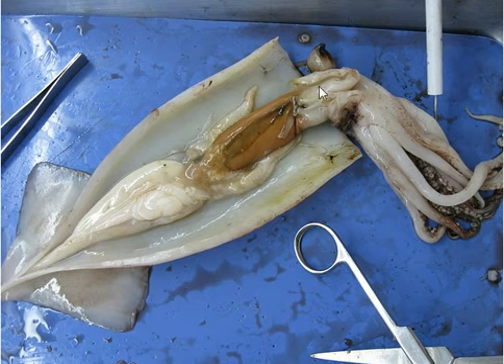There are these dot-like things on the mantle, and those are called chromatophores. So yeah, that's it. I think the squid dissection was the best dissection. Bye!